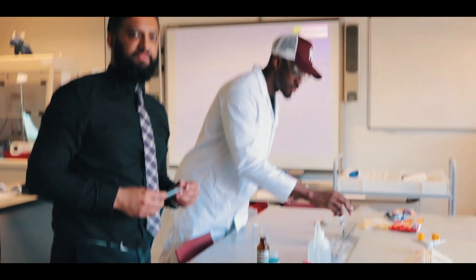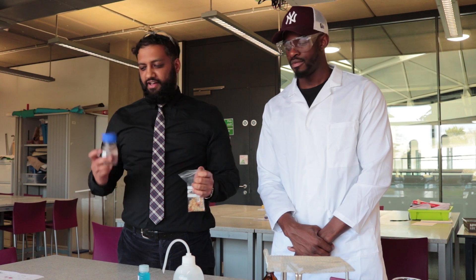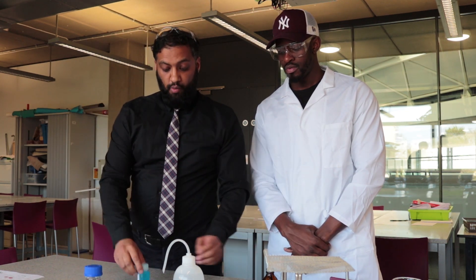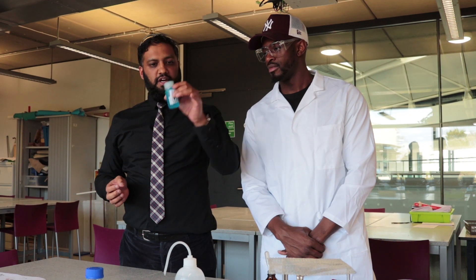What we're going to be doing now is testing for sugar. There are two ways we can do that. Carbohydrates - it's the smaller unit, simple sugars, so most probably glucose we're testing for. We've got two samples: a cake and a sugar solution. We're also going to be using something called Benedict solution - it's a bluey type of solution.